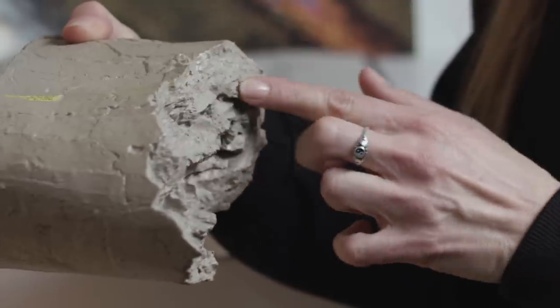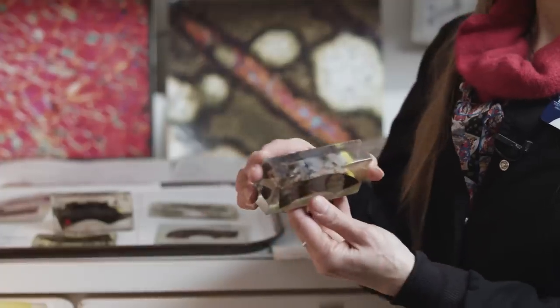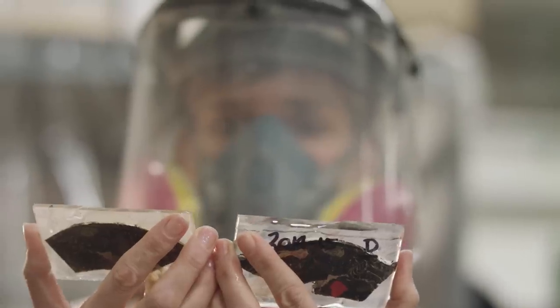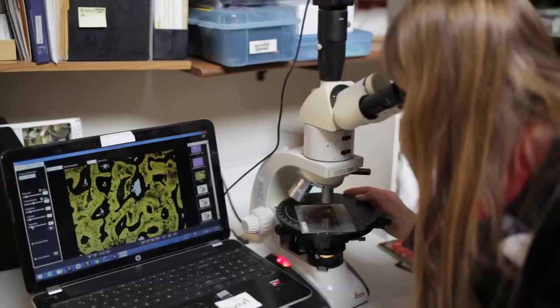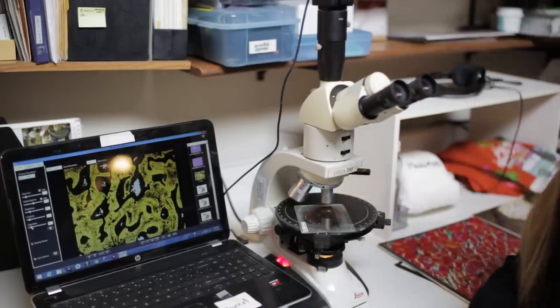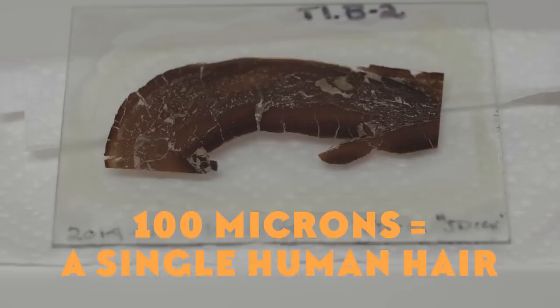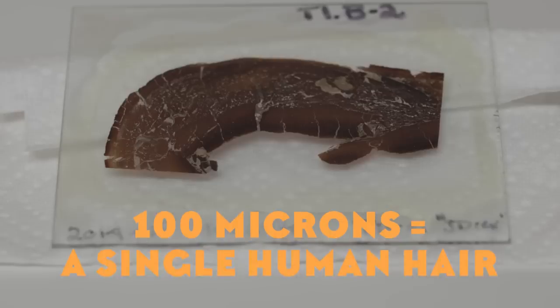So your whole process starts with a thin section. What is a thin section? To produce a thin section slide, we take a fossil bone, embed a small portion of it in resin, and then cut very thin wafers. Those wafers are mounted onto glass slides, ground even thinner until it's thin enough for light to transmit through and for us to see the structure under the microscope. A thin section slide ends up being about a hundred microns — a thin slice of fossil bone stabilized and secured onto a glass slide.